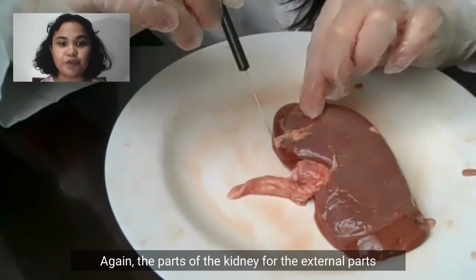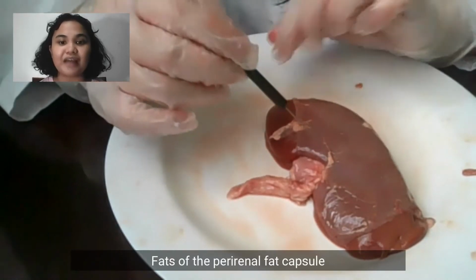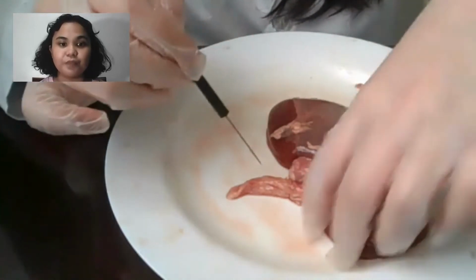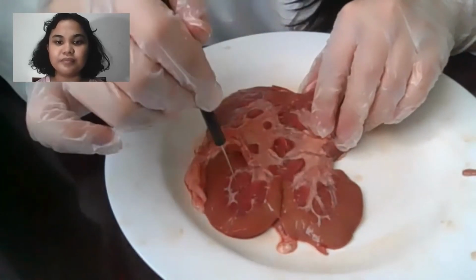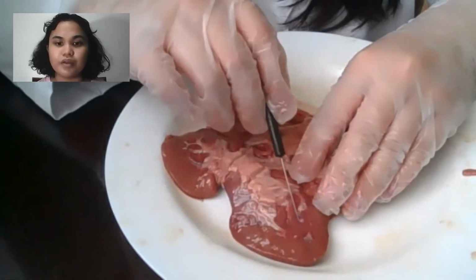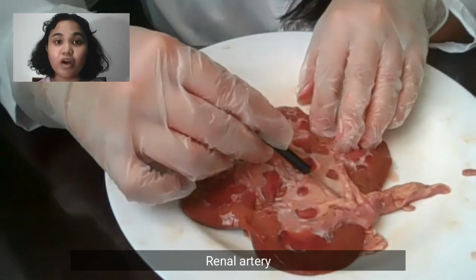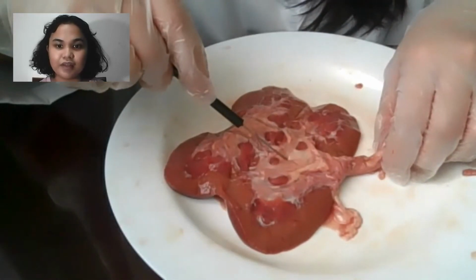Again, the parts of the kidney: for the external parts, we have the fibrous capsule, fats of the perirenal fat capsule, the renal hilum, and for the internal parts, we have the renal cortex, renal medulla, renal pyramid, the renal column, renal pelvis, renal artery, renal vein, and the ureter.